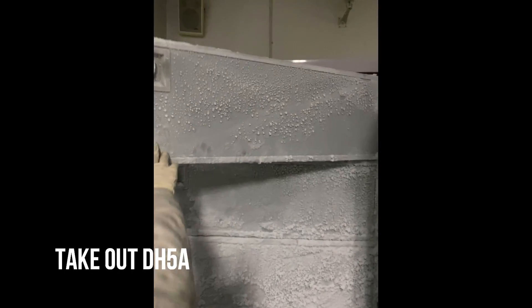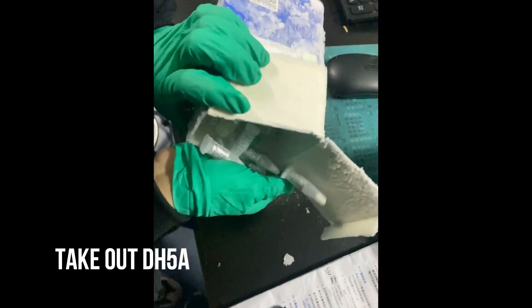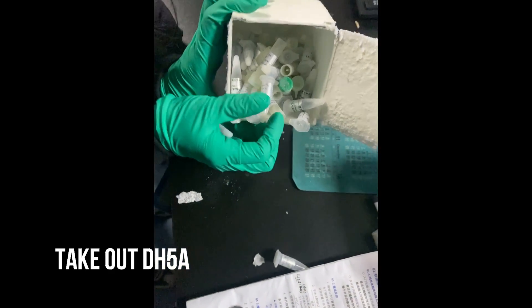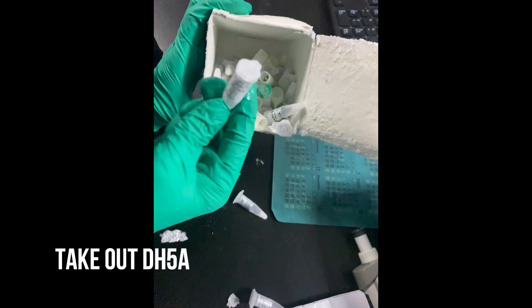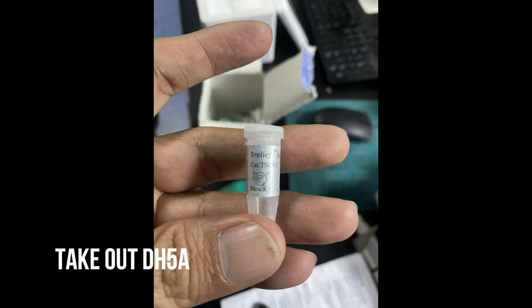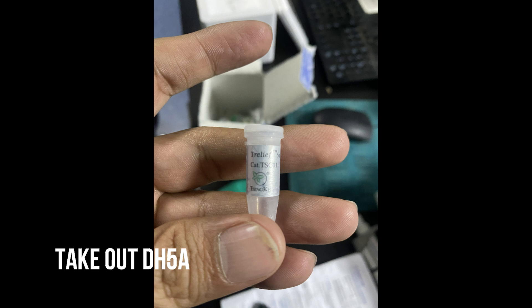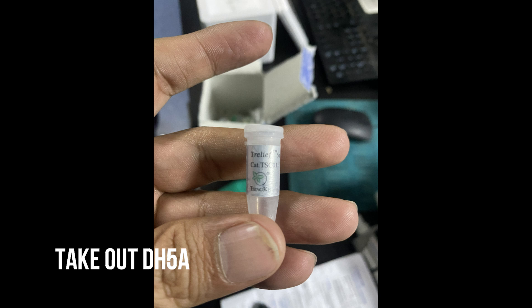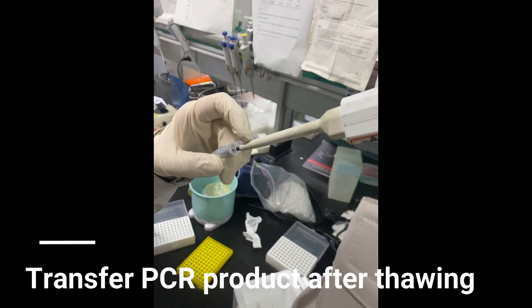This PCR product will be further transferred to DH5 alpha. We will take it out from minus 80 degrees Celsius so that it can be converted into liquid state, as it is in ice form. We can transfer the PCR product into DH5 alpha when it completely melts into water.